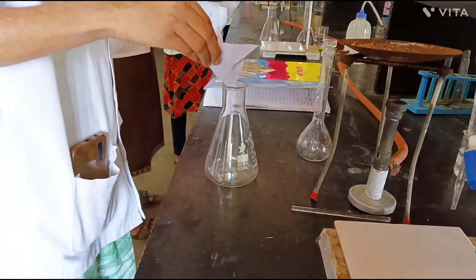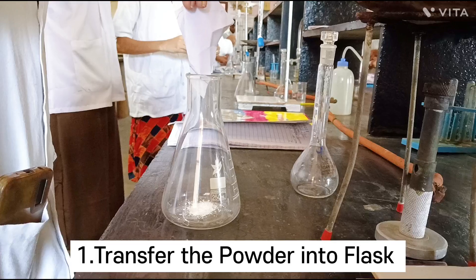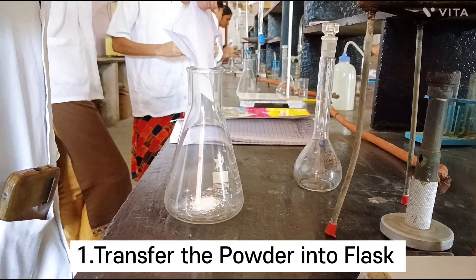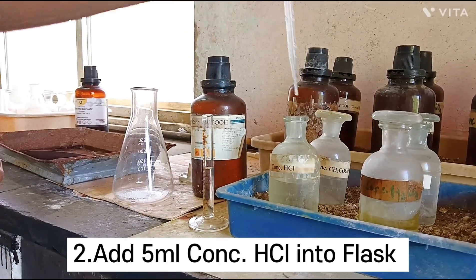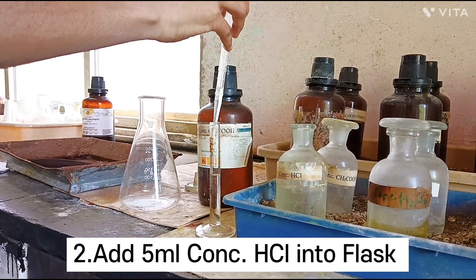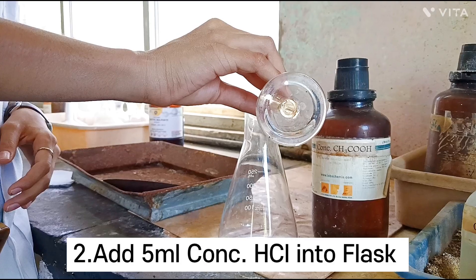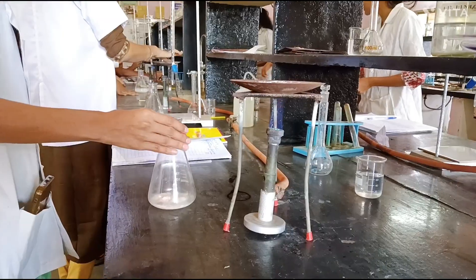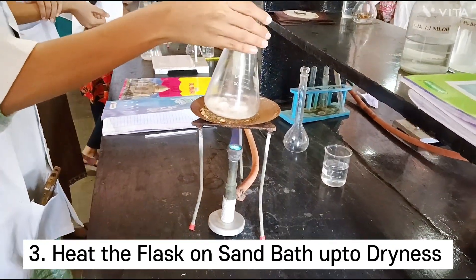The talcum powder sample given by the examiner is transferred into the conical flask. Care should be taken so that the sample is exactly added at the bottom of the conical flask. To the same flask, 5 ml concentrated HCl is added. The reaction mixture is heated on a sand bath up to dryness.